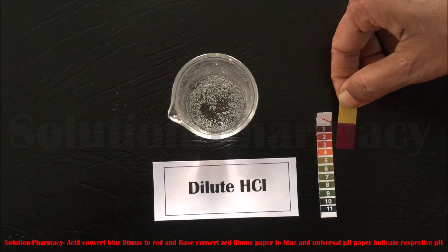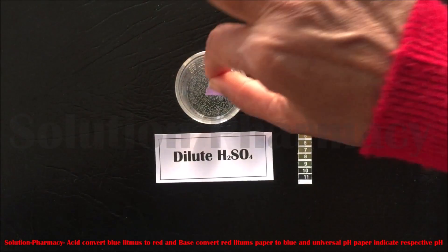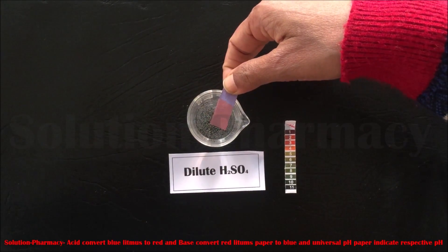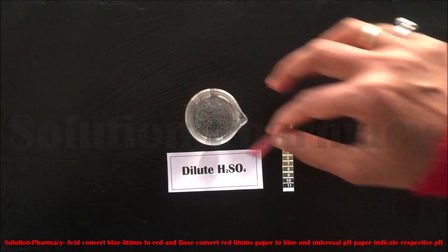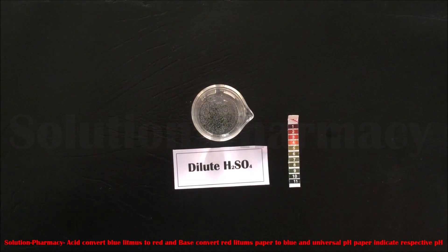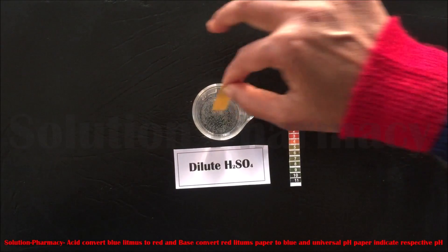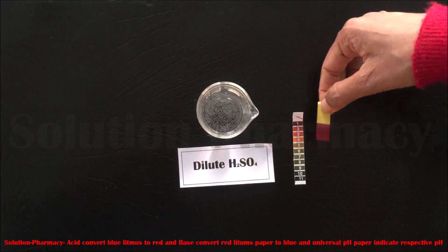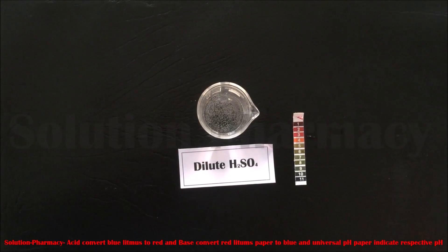The pH of dilute HCl is between 1 to 2. The next sample is dilute sulfuric acid. Dip the blue litmus into it — the color of the blue litmus changes to red, which means dilute sulfuric acid is acidic in nature. Next, dip the red litmus into it; there is no color change in the red litmus paper, meaning the solution is not basic. Dip the universal pH paper to determine the pH. The color of the pH paper changes to the value 2, so the pH of dilute sulfuric acid is about 2.